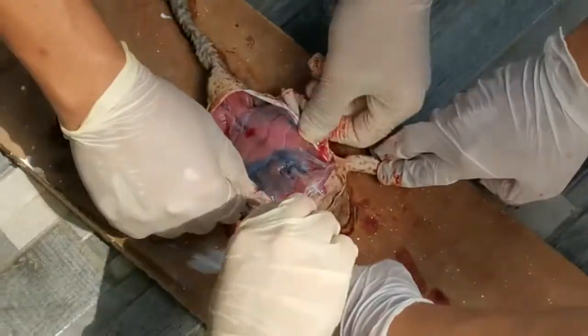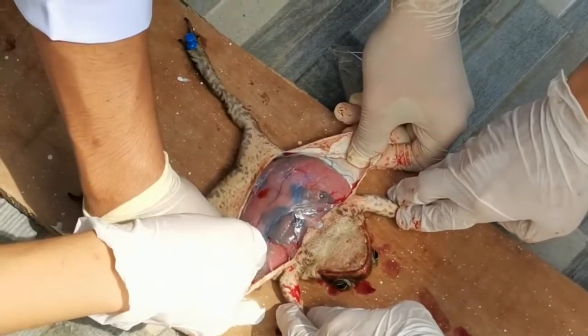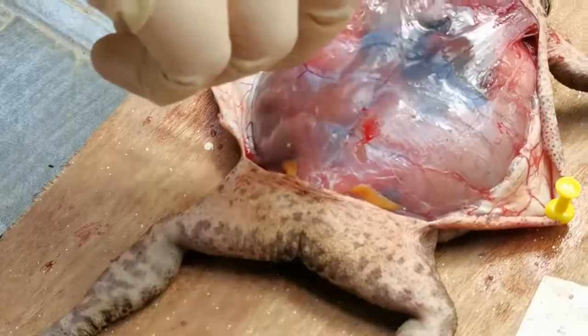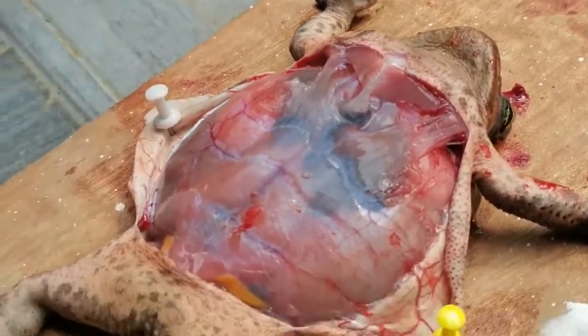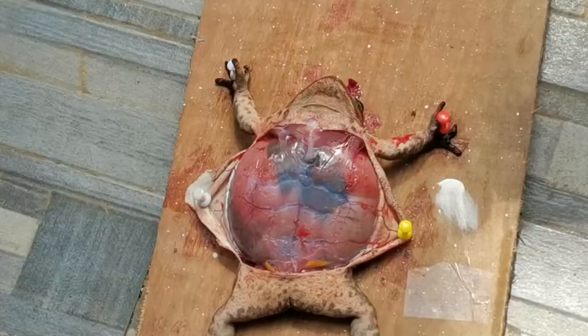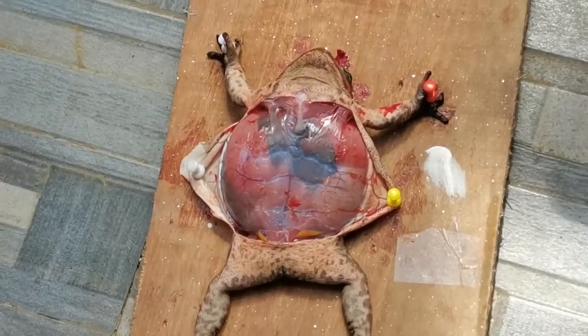In the chest region, you will have to cut through the breastbone. Again, make right angle cuts from each end of the long incision. Fold open and pin down flaps of the skin and body wall. Make additional cuts in the breastbone to expose the organs in the upper body.